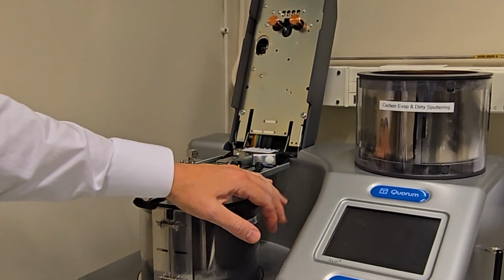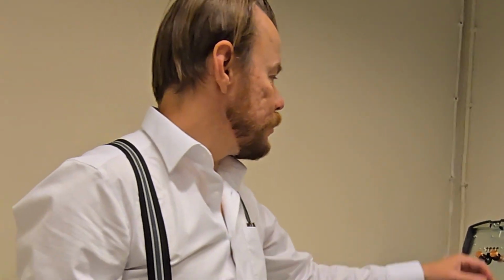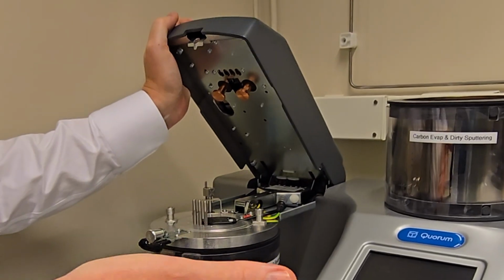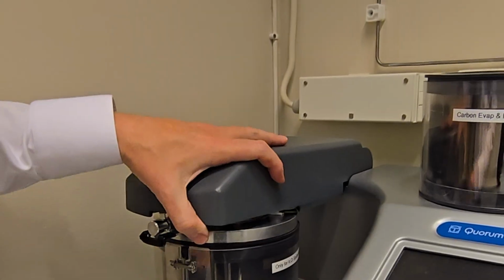Why do we coat the samples? All the samples in an electron microscope must be electrically conducting. If they are not electrically conducting, then we need to add an electrically conducting layer on top. That's why we coat them. If you have a metallic sample, let's say you work in the metallurgical field, then you don't need to do the coating at all. But why should I use different types of metals for my coating? Why iridium? Why not gold, or aluminum or something else? That is a very important question.